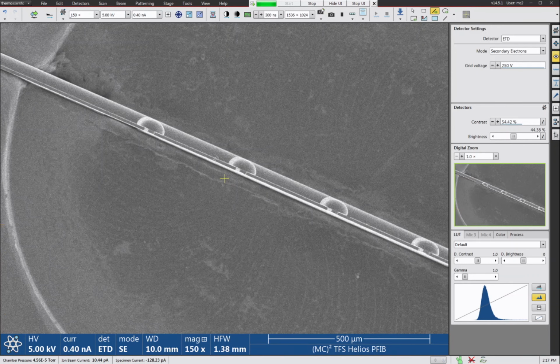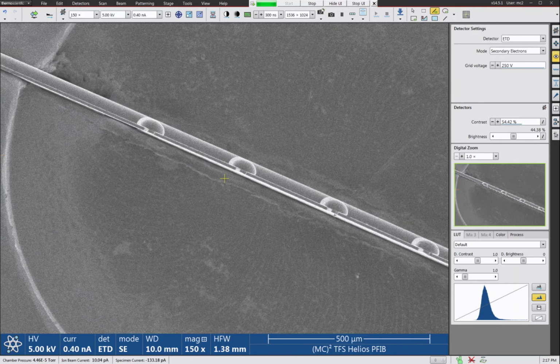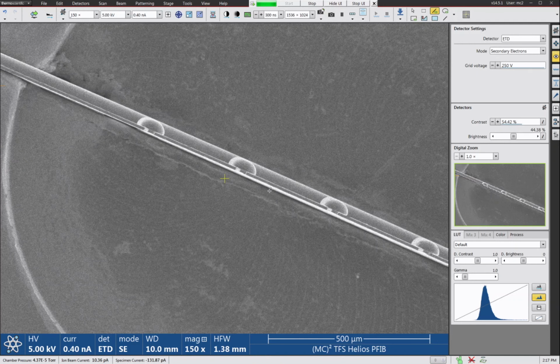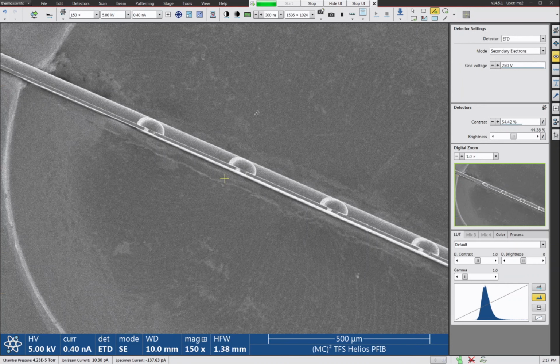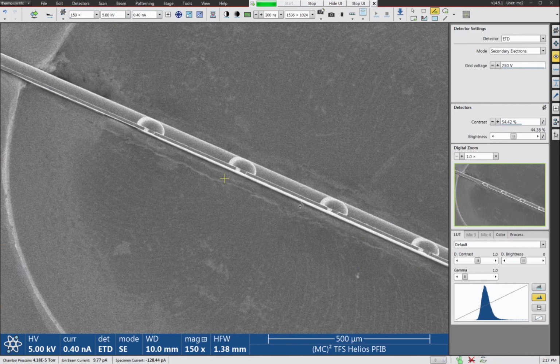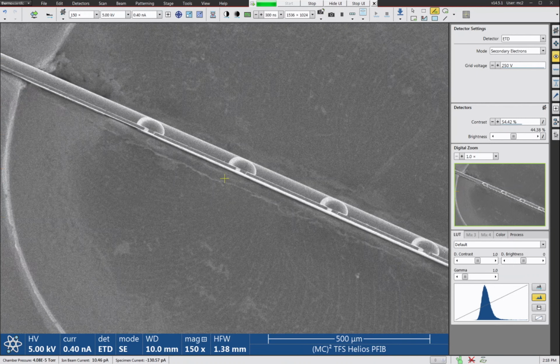1, 2, 3, 4. I would recommend that you do not sharpen adjacent grid fingers. They are too close together. When you run these in the atom probe, you're likely to blow up the neighboring posts. And in fact, the safest thing I think is to actually just sharpen the outside two fingers on each grid. So each grid will have two posts. I've got two grids in here. That would be four posts total.